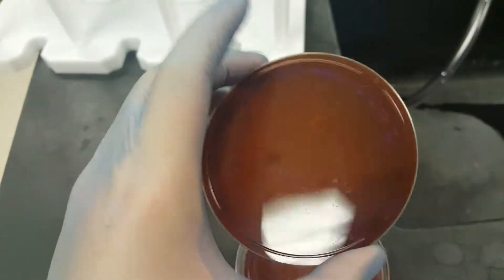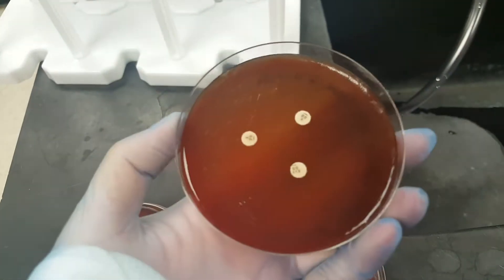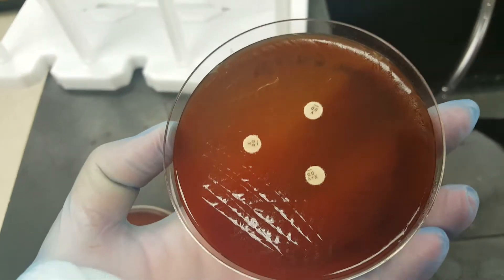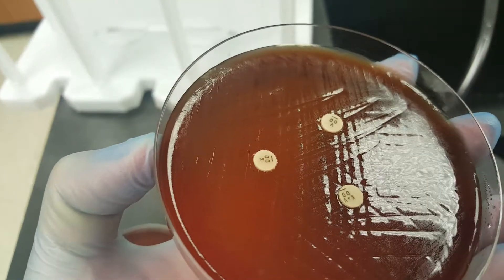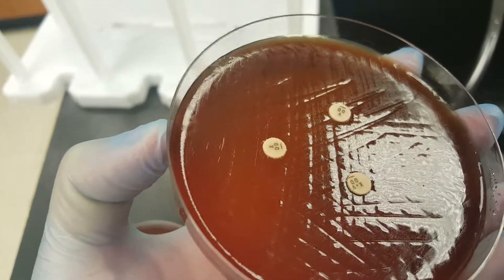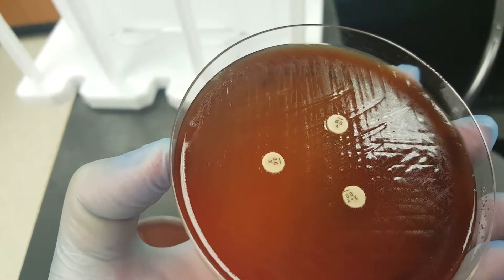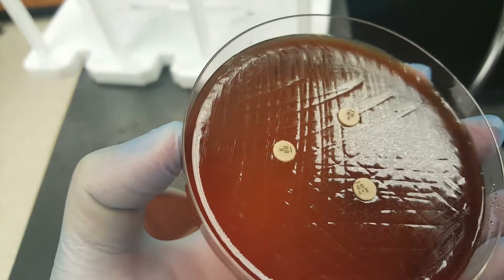This organism was Haemophilus influenzae, and it is one of the three clinically significant organisms that do need both. As you can see, there is a little bit of light growth all over the plate — see the little dots on the sheen. This is a blood agar plate, so in order for the organism to grow, we do need to have those nutritional discs on there. They're not susceptibility discs, they're nutritional discs.